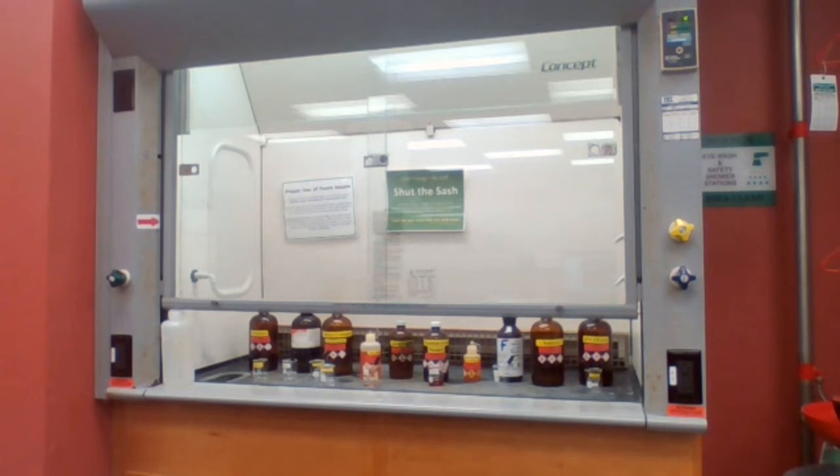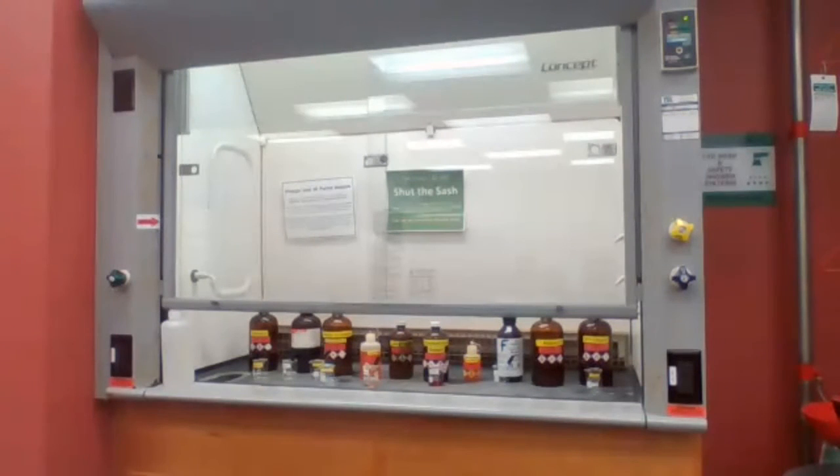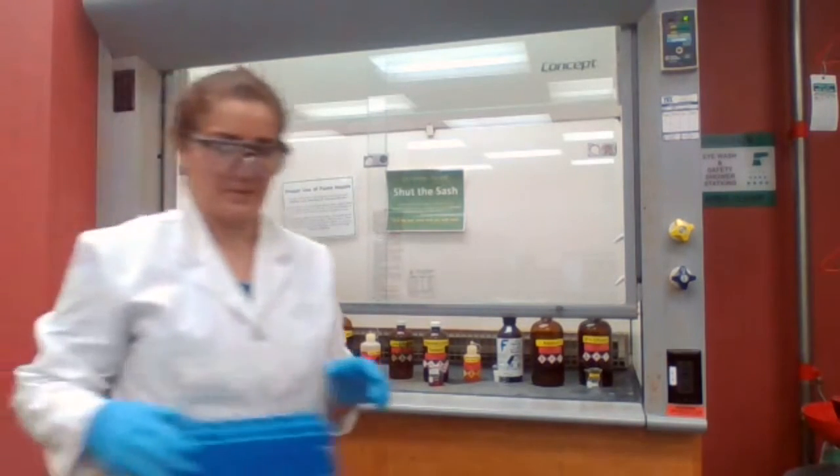Is this solid? Okay, while you're waiting for the phenol, I want you to get one spatula and a test tube.